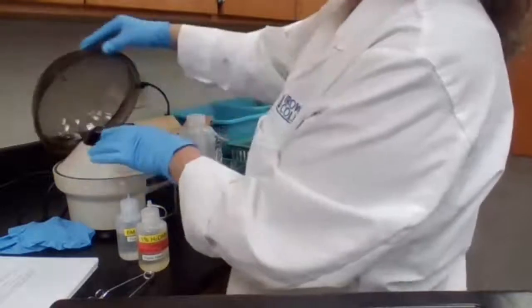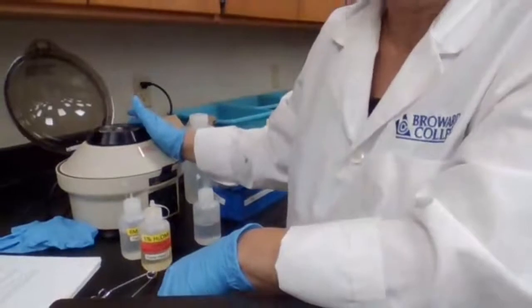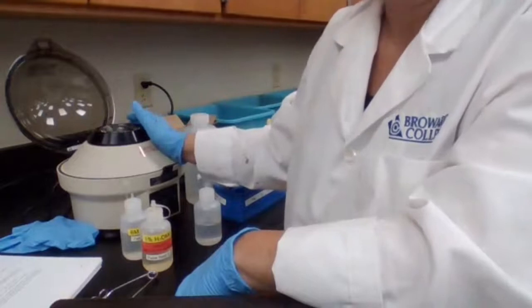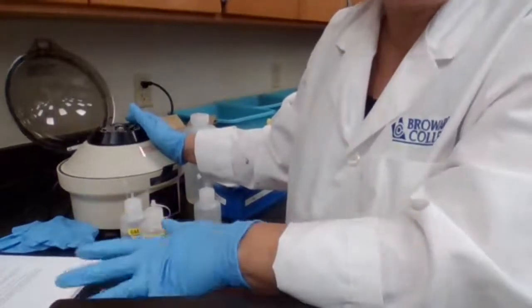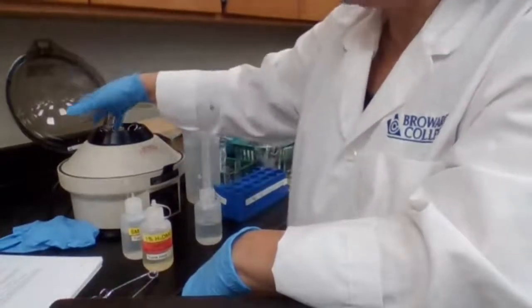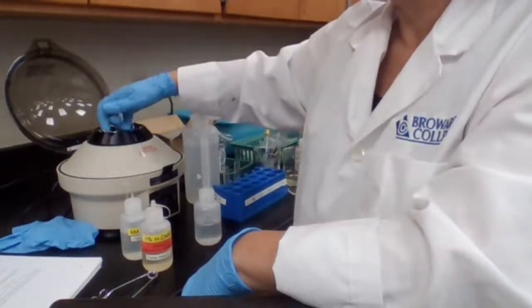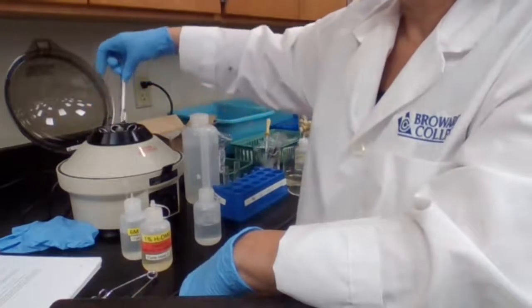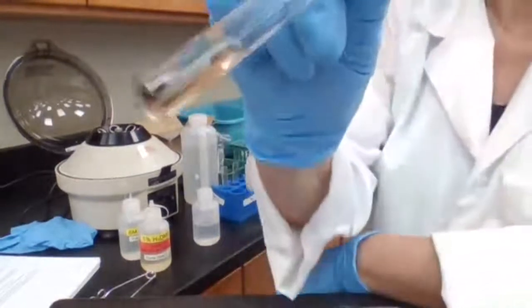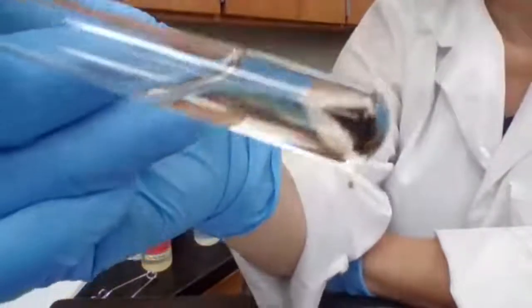While we are performing the experiment, as I said, there is some downtime. If you were in the lab, you would have had the same experience, but since it's a group of you and you could ask questions and talk to each other, it doesn't seem like you're waiting. But what I suggest you do while there is downtime is start thinking about your observation, recording what has happened today versus what you had from last class, and compare the unknown to the known sample.